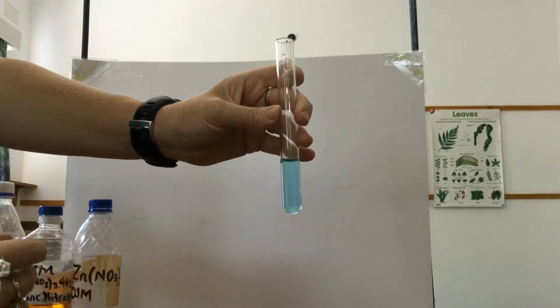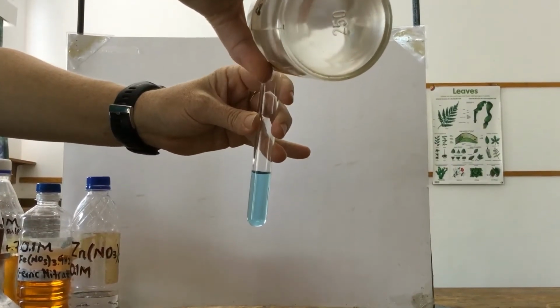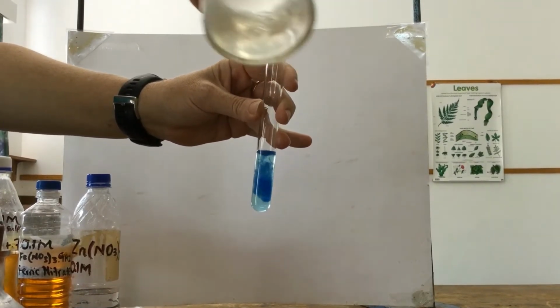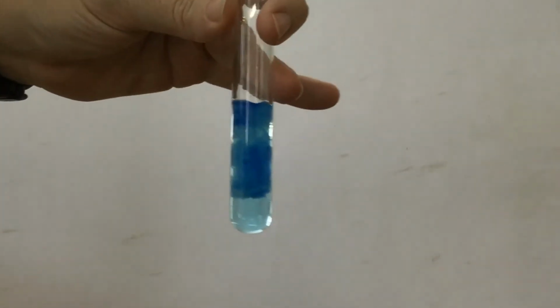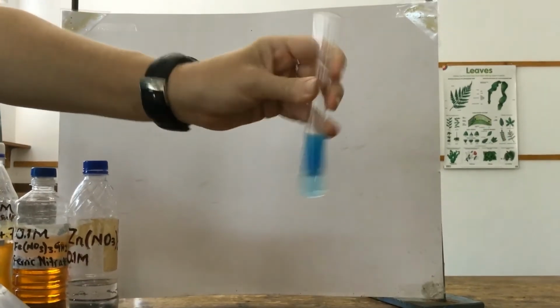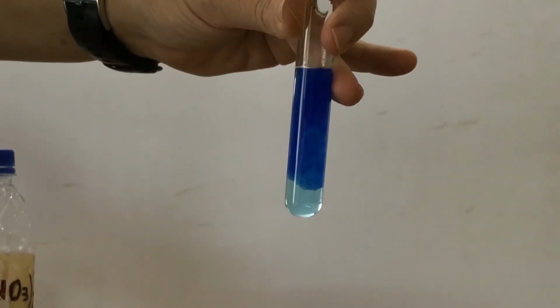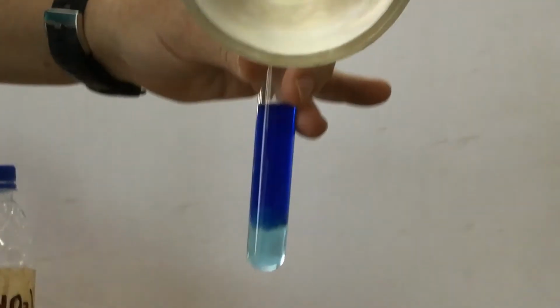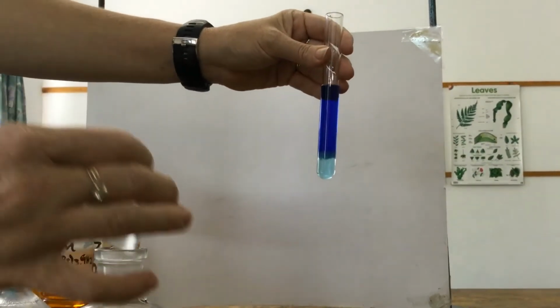Okay, if we add ammonium hydroxide to copper ions, you see that we form a light blue precipitate. And again, it's quite gelatinous. If I keep adding ammonium hydroxide, this precipitate will dissolve, leaving a dark blue solution. So let's just mix it up a bit. I'm going to add excess ammonium hydroxide, and we should start to see that precipitate dissolve and form a dark blue solution. At the bottom you can see some precipitate still there, but at the top where it's all mixed nicely, it's dissolved, and that is a positive test for copper ions.